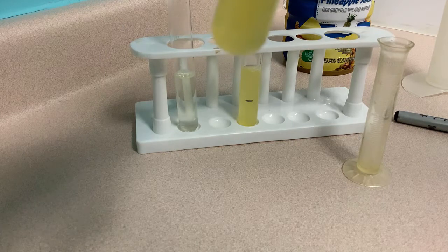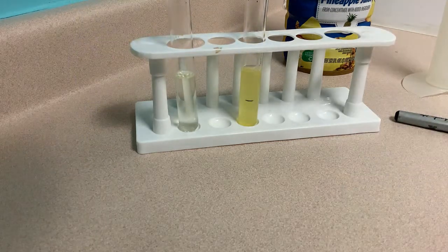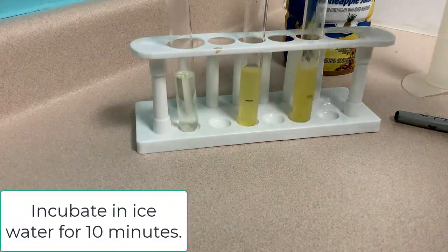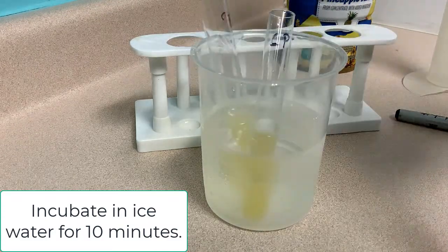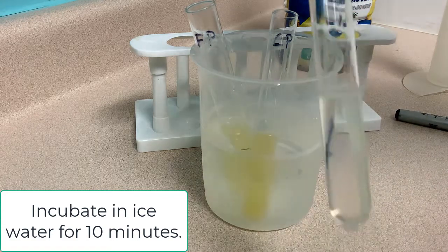Let the mixtures incubate for about one minute at room temperature. Then incubate on ice for 5 to 10 minutes or until the gelatin water mix solidifies.